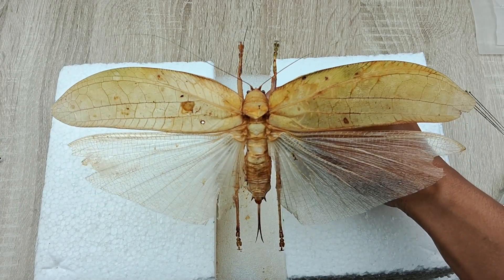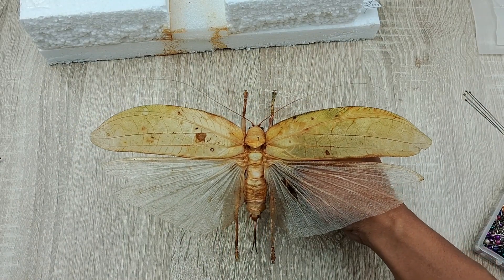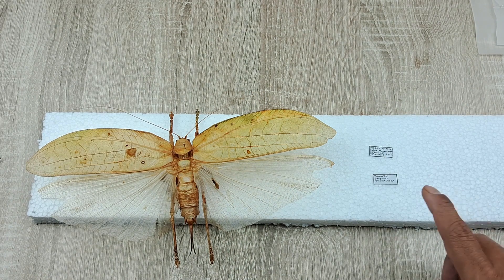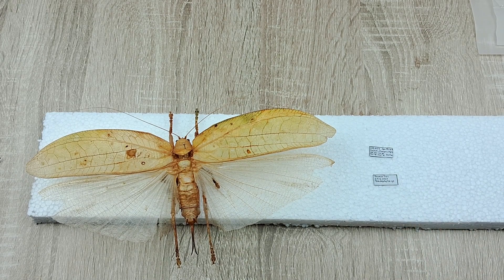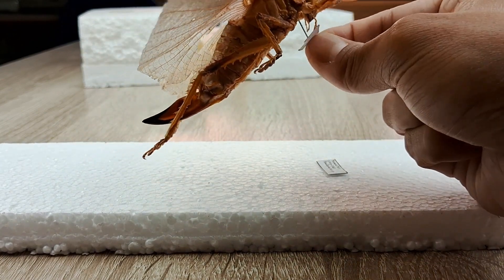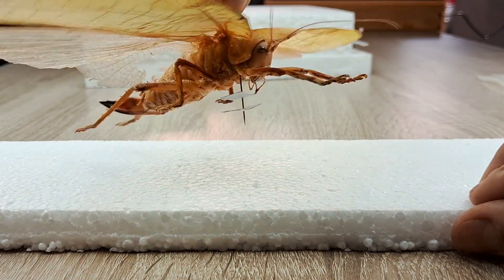And there you have it! Your pinned specimen is ready to be used for your project, art or otherwise. If the specimen is however for science, you will need to prepare an appropriate label or labels containing all necessary collection and specimen info in standard size insect labels like the sample shown here. Attach the labels underneath the specimen on the same pinning needle like so. I'll probably be making a video in future on how an insect label is prepared and what details need to be included.